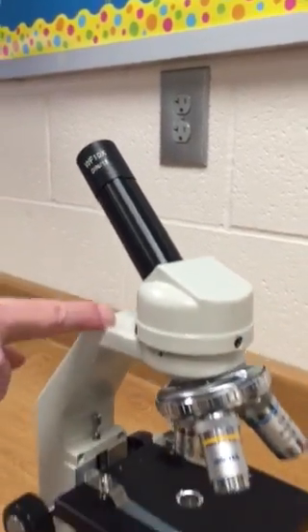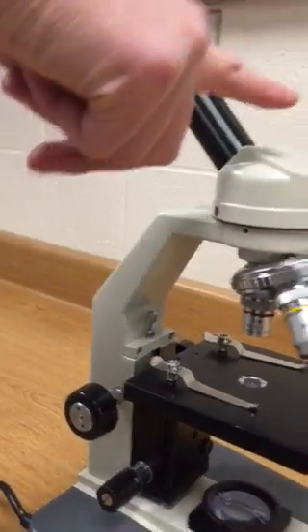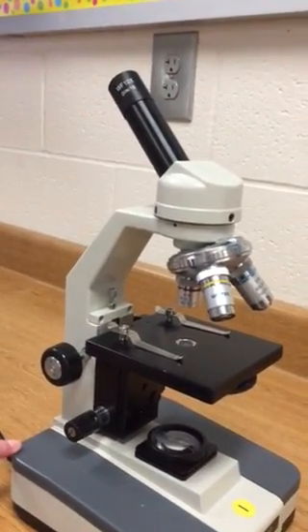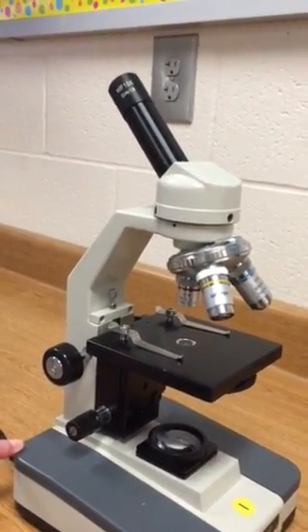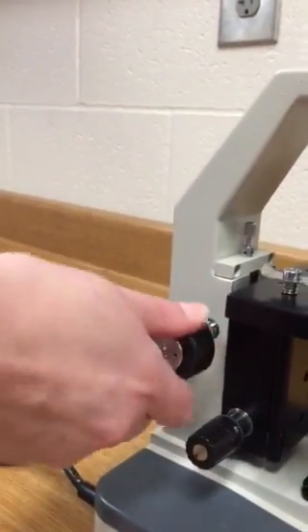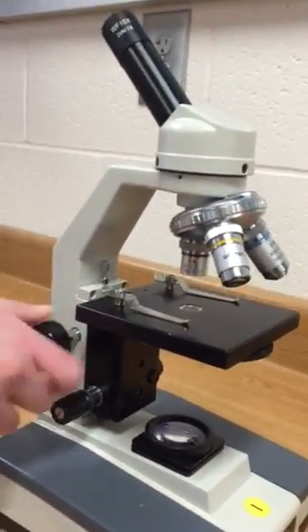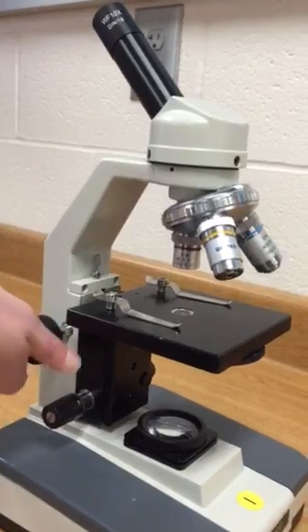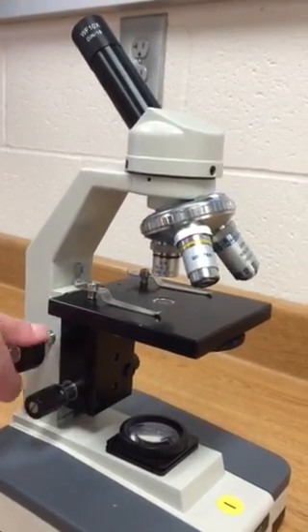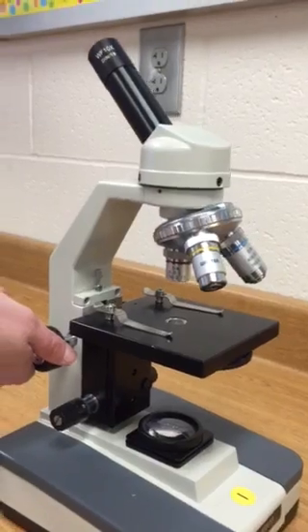Here we have the arm of the microscope, which connects the eyepiece to the base. Here we have the coarse adjuster, which moves the stage up and down. When you move it towards you it moves up, and when you move it away from you it moves down.